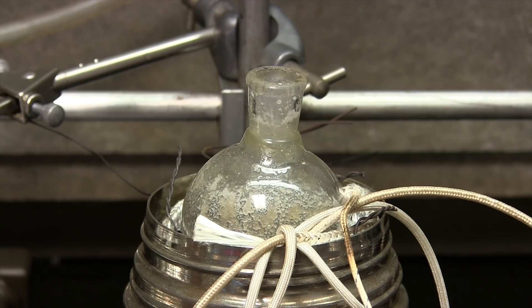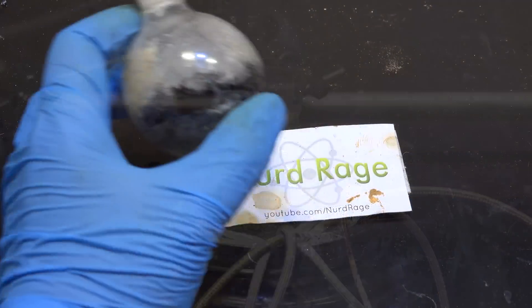The reason why we're going through all this trouble is that we want a solid mass of platinum rather than a syrup. A dry solid mass shouldn't pop or sputter when we incinerate it later.